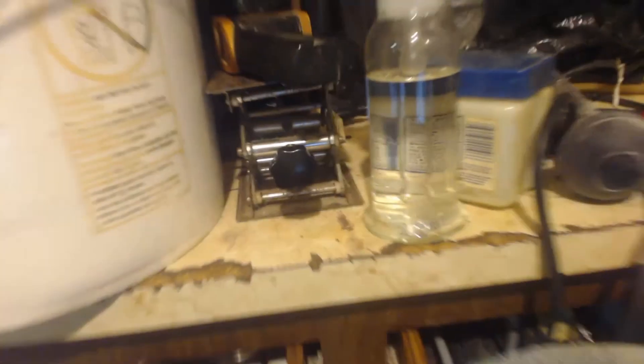It's already at 69 degrees and I don't even have a milliliter yet. This was basically a waste of time. If I do this again, I'll just redump the first pot back into the reaction. It's at 72, now 73 degrees — about a milliliter in there. So this was a waste of time, but I just wanted to see how much was in here. We're going to move on to the bubbler, where hopefully there's a lot of product.